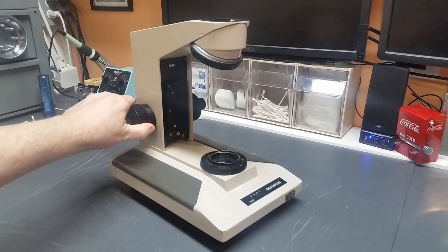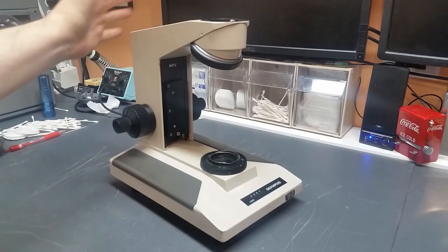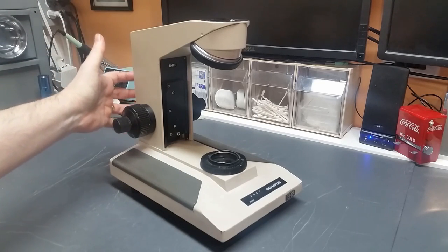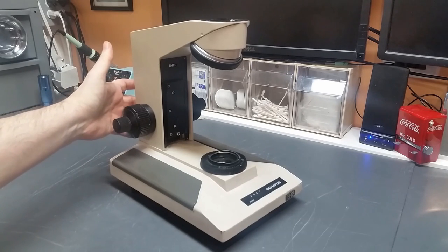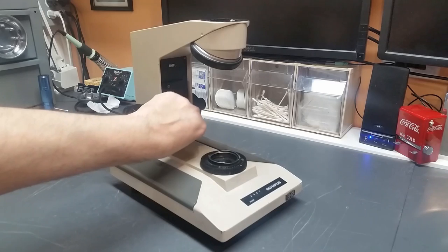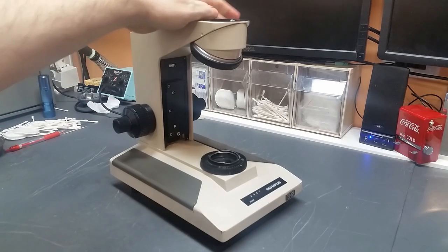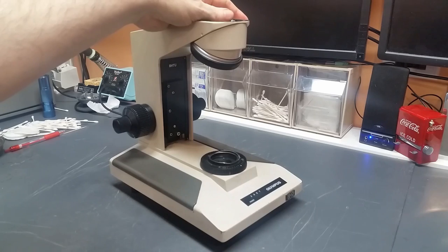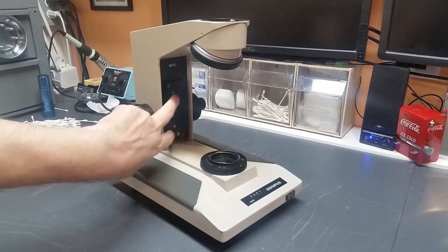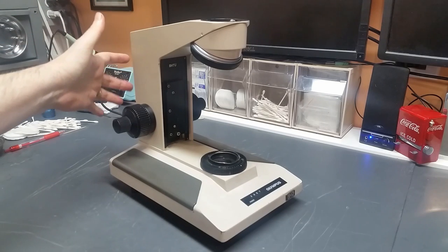service as well. If you've been following along in part one, then your scope will be in a situation where the back cover is off, your gearbox is out, and the brass rack, focus rack, on the back of the focus block here, will be removed from your scope. If that's the case, just skip ahead to step four on this, and you should be back on track. If you have not performed the service in part one, then I will show you now how to remove the back cover, gearbox, and the focus rack.